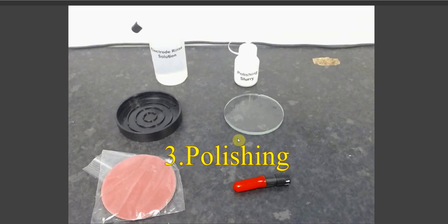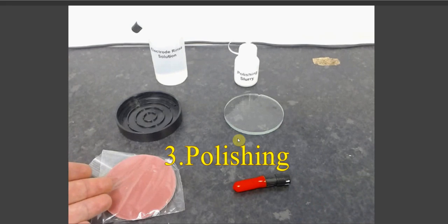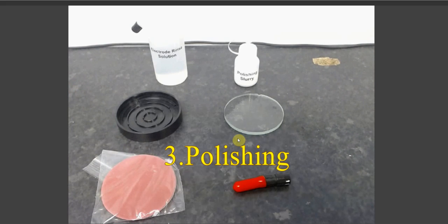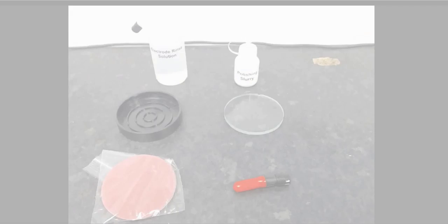For the polishing and preparation of your Metalyser electrodes, you'll require your working electrode, your polishing pad, the glass plate, the plastic holder for the glass plate, your polishing slurry, and your electrode rinse solution.